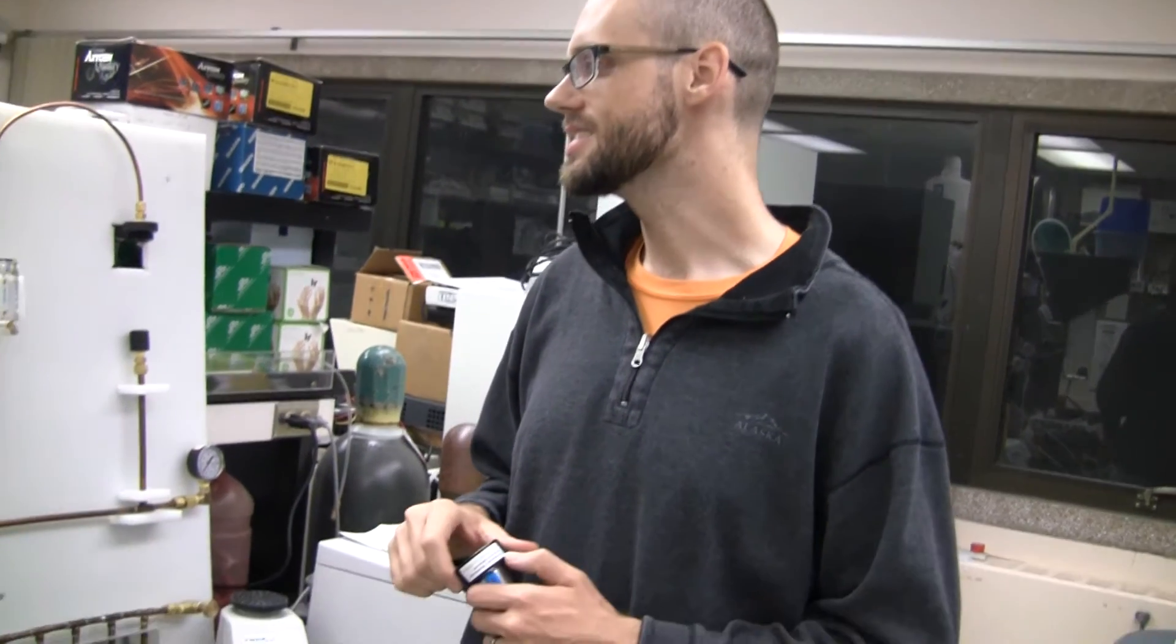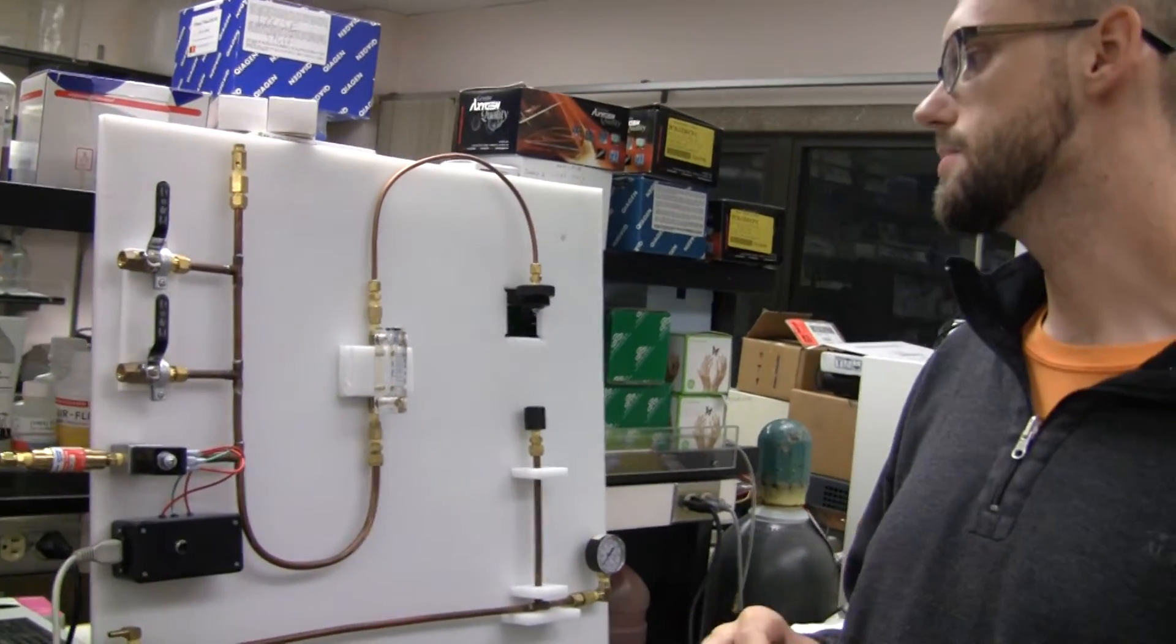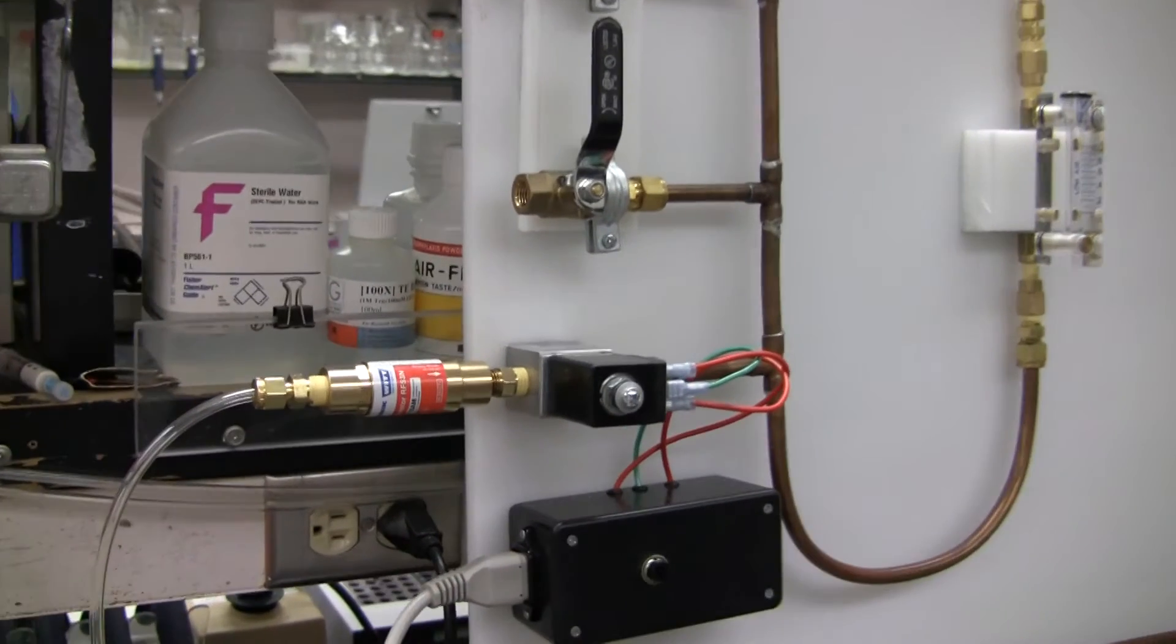Greetings. This is Seth. And here's your manifold. We got the flashback arrestor in today. Here's what it looks like.